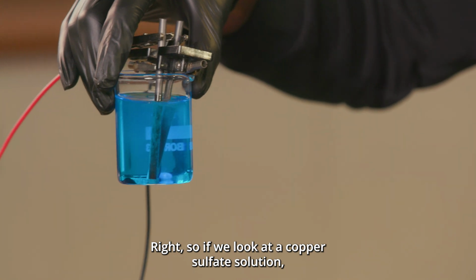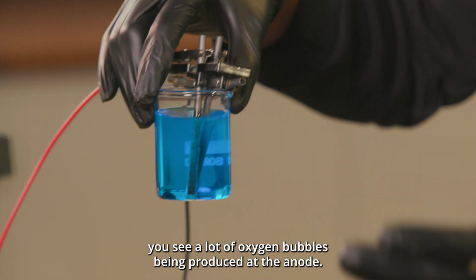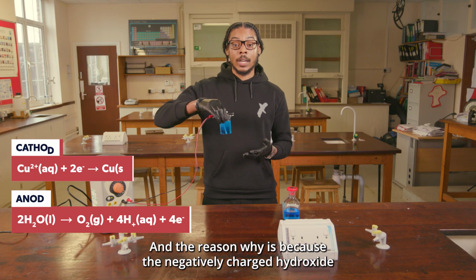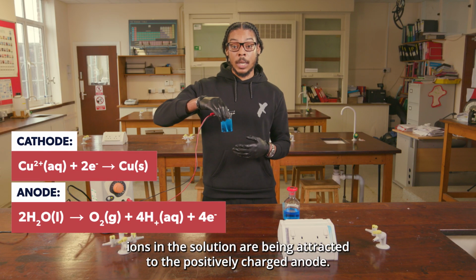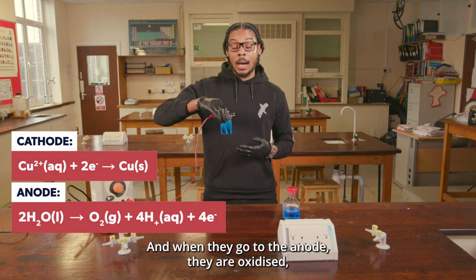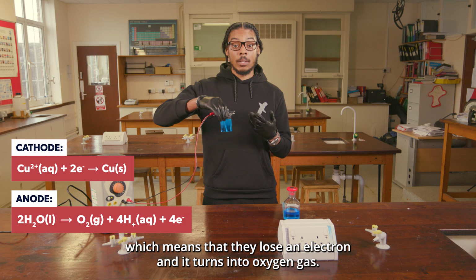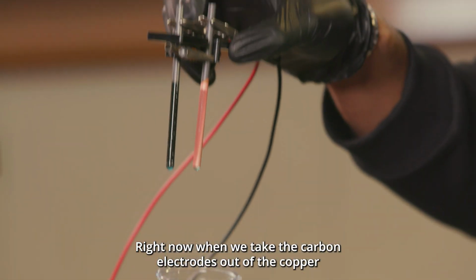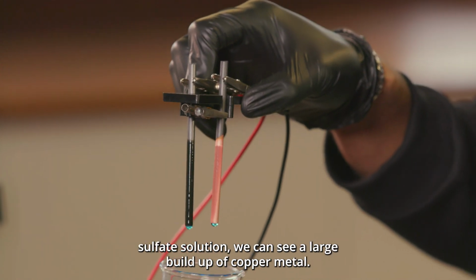Right, so if you look at the copper sulfate solution, you can see a lot of oxygen bubbles being produced at the anode. And the reason why is because the negatively charged hydroxide ions in the solution are being attracted to the positively charged anode. And when they go to the anode, they are oxidized, which means that they lose an electron and it turns into oxygen gas.